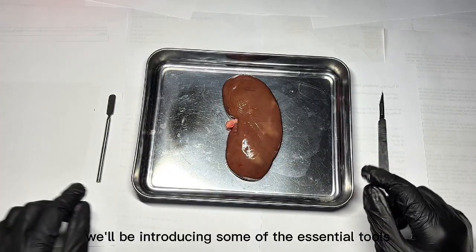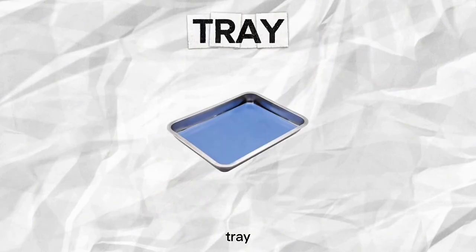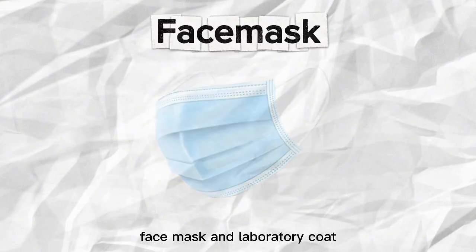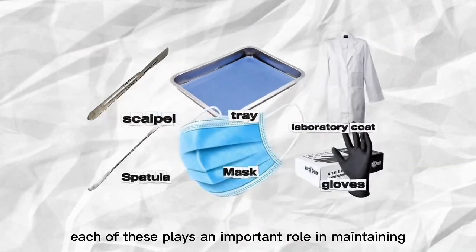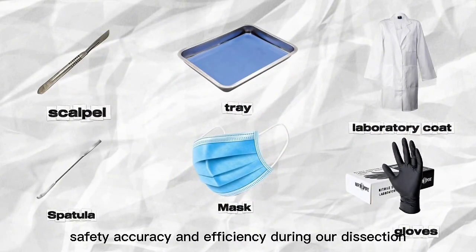We'll be introducing some of the essential tools used in dissecting the kidney. We have the dissecting spatula, scalpel, tray, gloves, face mask, and laboratory coat. Each of these plays an important role in maintaining safety, accuracy, and efficiency during our dissection.